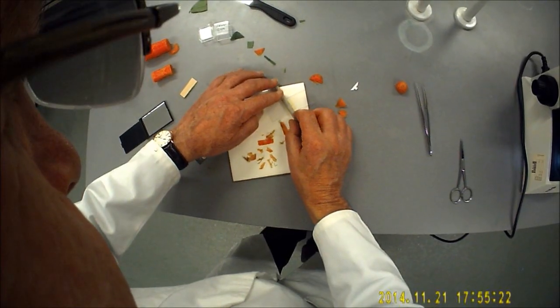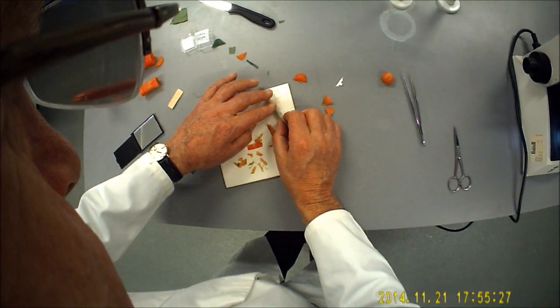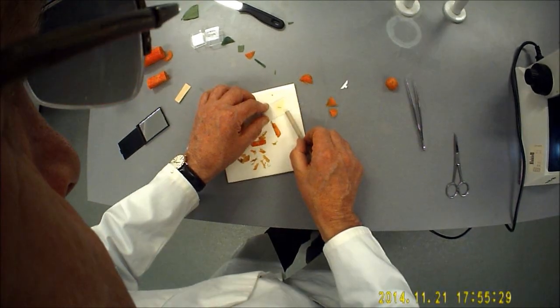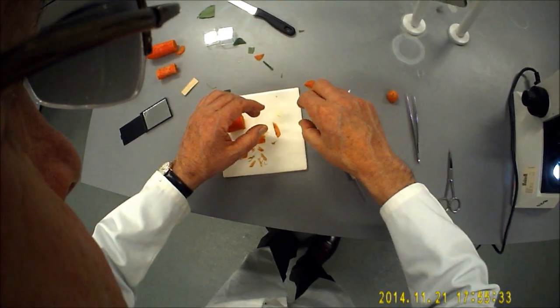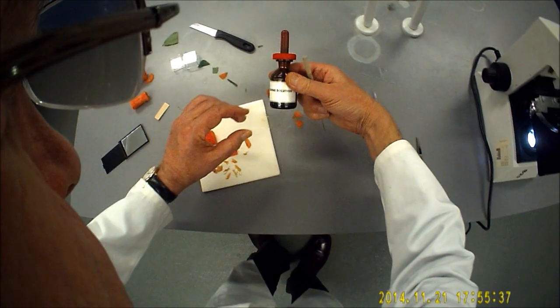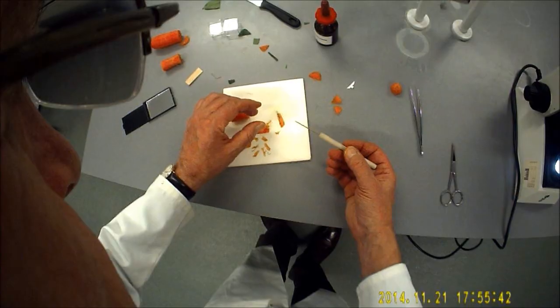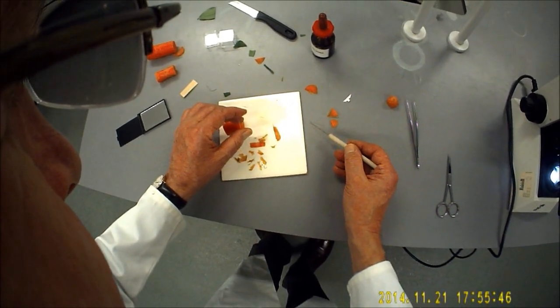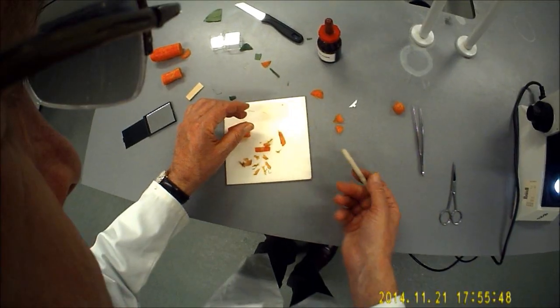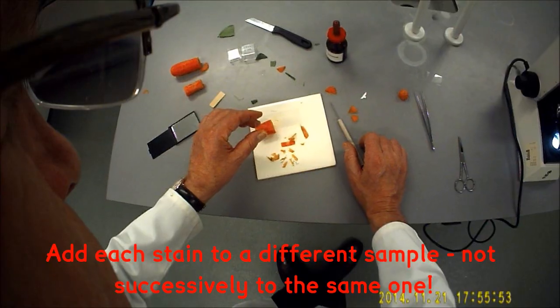Use the mounted needle just to roll it through to get rid of any air bubbles. Now you notice that for my specimen I used iodine solution. That's one of the stains you'll be using. You'll also be comparing that to distilled water and to a range of other stains as well, and each stain should highlight a different aspect of the leaf.